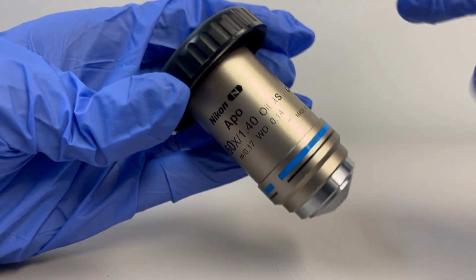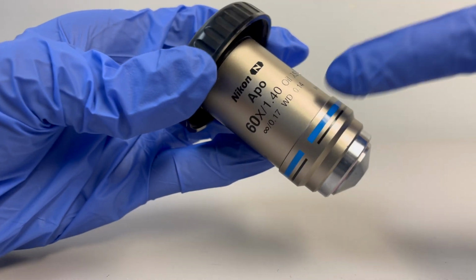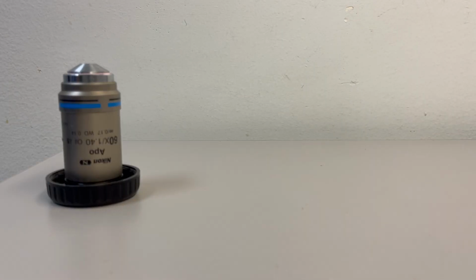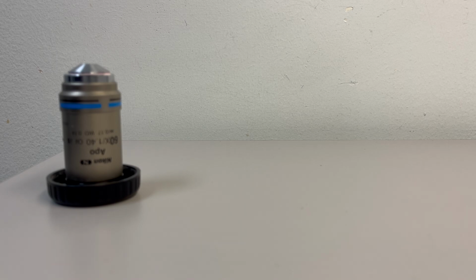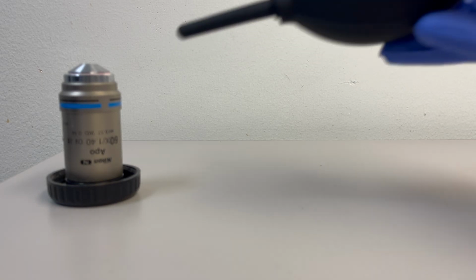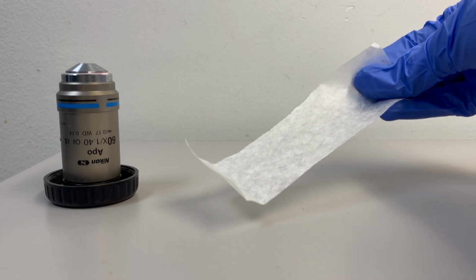The last example for the purpose of this video is an oil immersion medium lens. These are also typically labeled as shown here. Again, we want to avoid scratching the surface of the lens with debris, so blow off the surface of the lens first. We can use the pink lens cleaner solution provided for each instrument. However, oil can be more difficult to clean, in which case we can use isopropyl alcohol and lens paper, also provided at each instrument, to help.